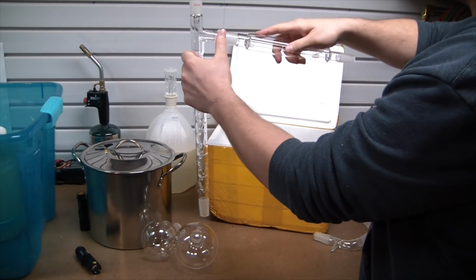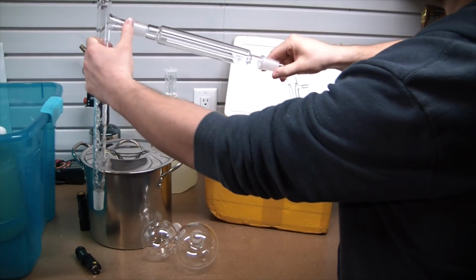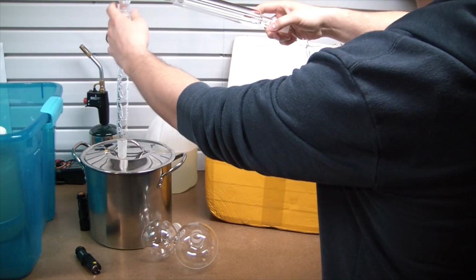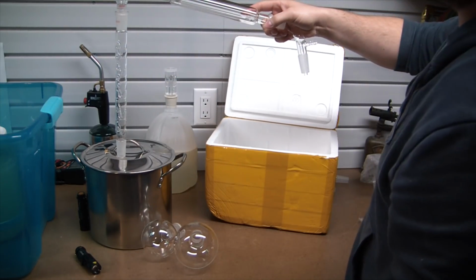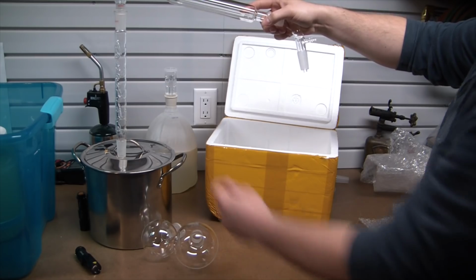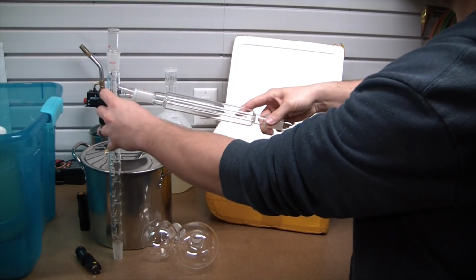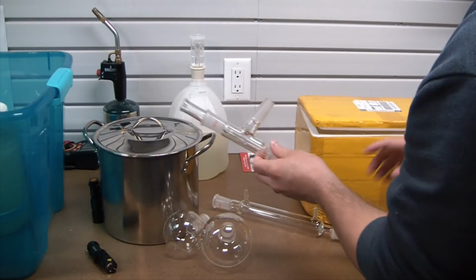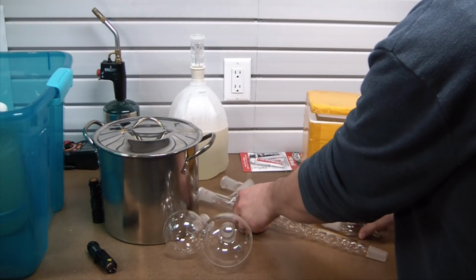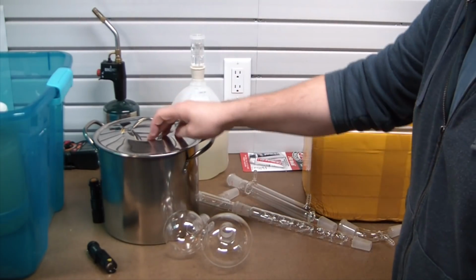Trying to hold this all without letting anything fall. And so, this is what our setup's gonna look like. I don't even know if that fits on screen, but pretty good little setup in my opinion. I think this will work nicely. But the critical part is gonna be adapting the glassware to the stainless steel.